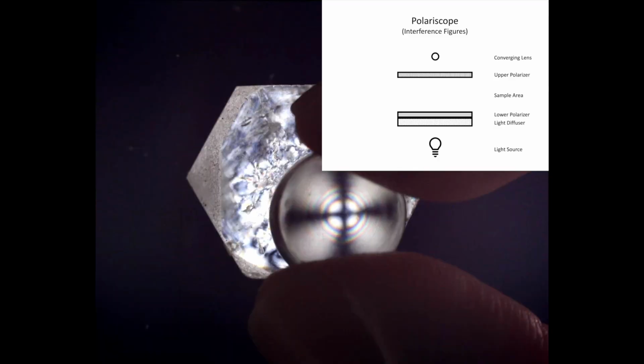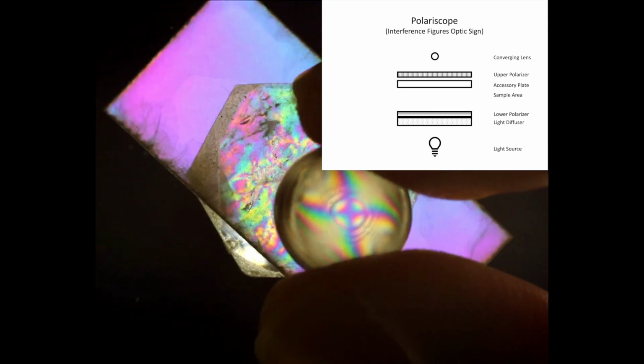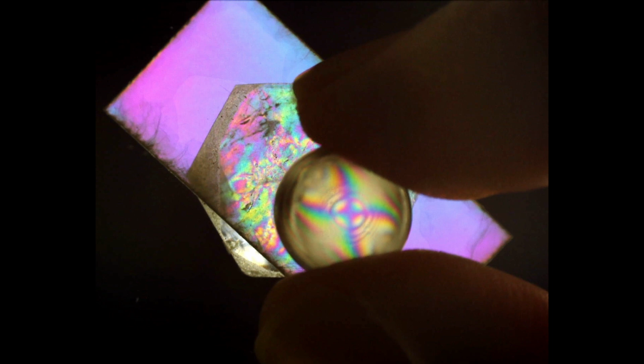We also explored how having a known oriented muscovite plate can help us determine things like optic sign for unknown samples. In particular, we looked at a beryl specimen and how our oriented muscovite plate can be used as an accessory plate in order to generate a whole new type of interference figure. One that allows us to determine optic sign based on addition and subtraction of interference colors.